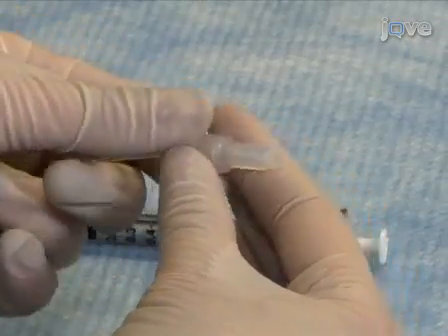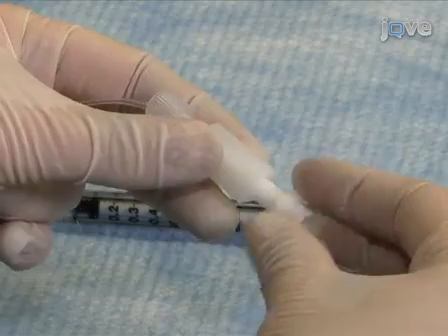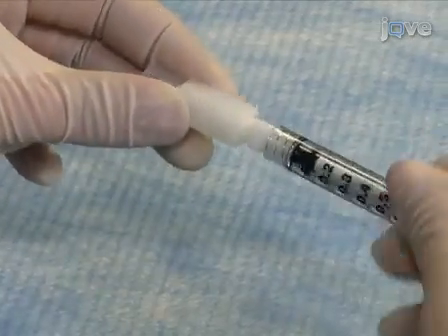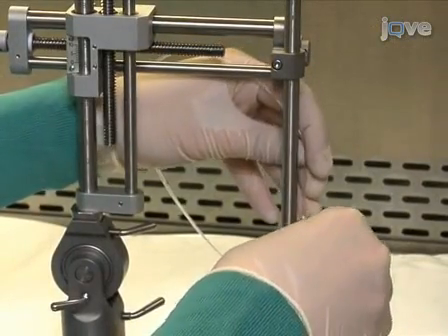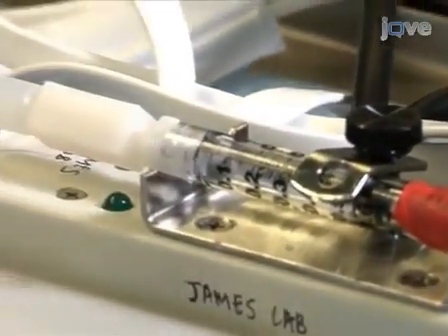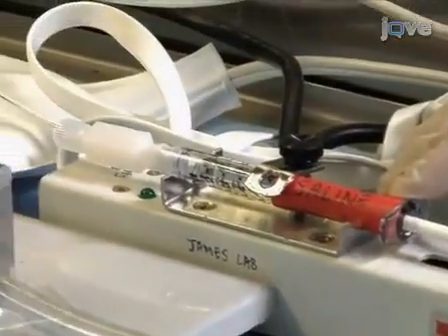To set up the cannula, attach a 1 ml syringe to the Teflon tubing using a set of plastic syringe adapters. Affix the cannula to the stereotaxic frame so that it's perpendicular to the surgical surface. Using a 1 ml syringe, disinfect the cannula by running 70% ethanol through it. Repeat this process using sterile saline.